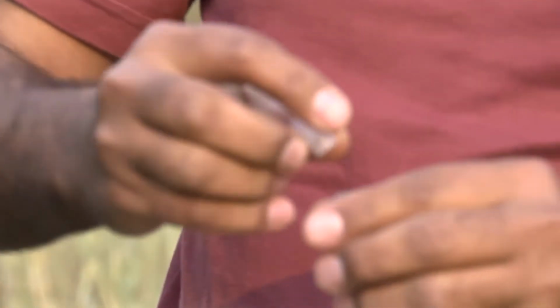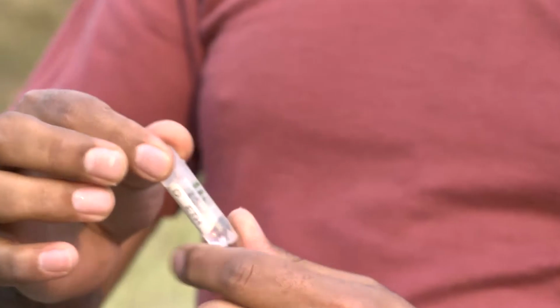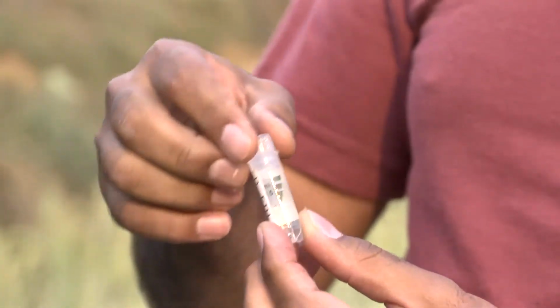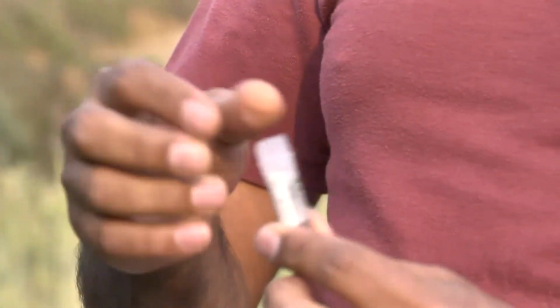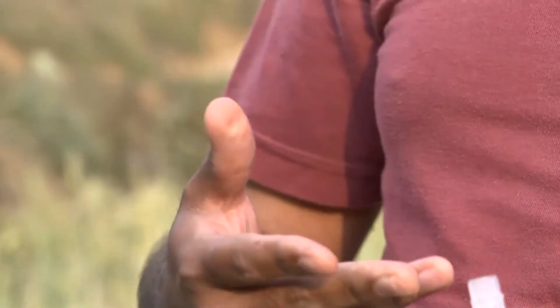Cover it and leave it for 2 to 3 days. The spores, the aecia and any other organism or microorganism on the leaf will die with this, and then after 3 days you just throw out the alcohol and send this dry sample either to my lab or to Eugen lab, having their consent.